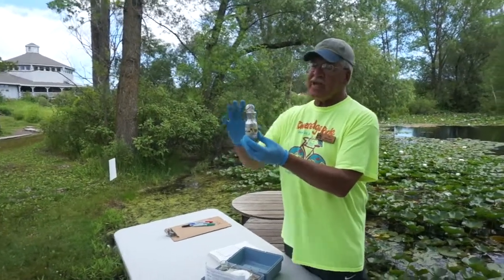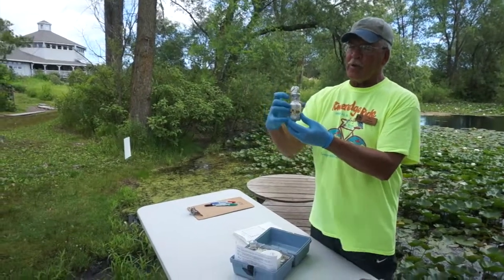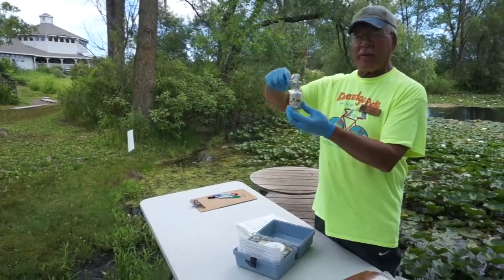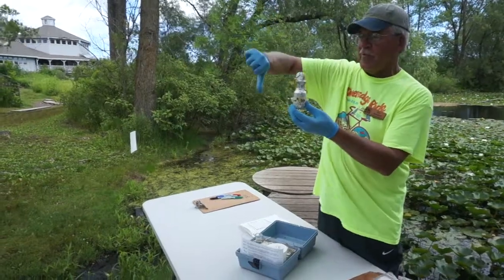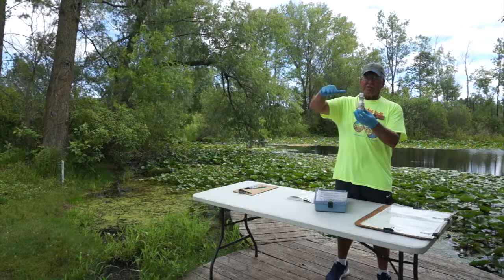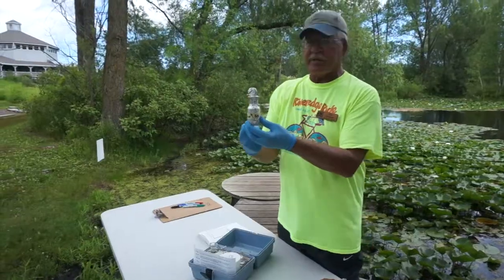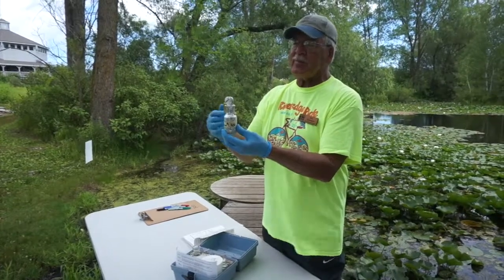When it sits for 5 days, these little bacteria guys that are in this water are going to gobble up the organics, and we would expect that if there were any bacteria in there, our oxygen level would go down. That's what we would expect. If the oxygen level doesn't go down and stays the same, we've got no organics in our water. There's nothing for the bacteria to live off of. So it's about as simple as that.